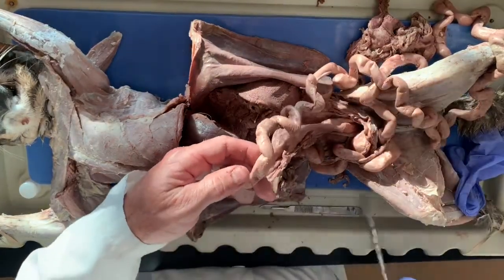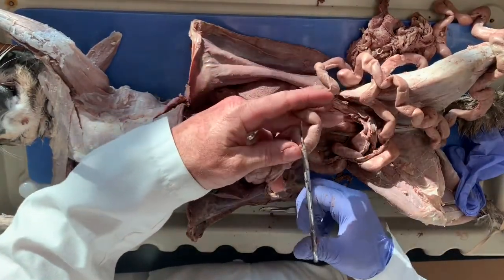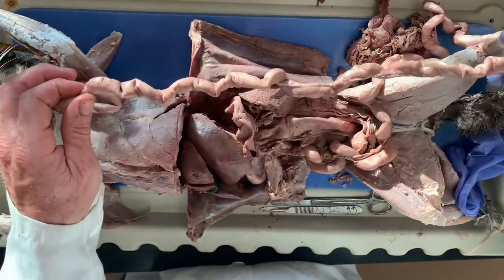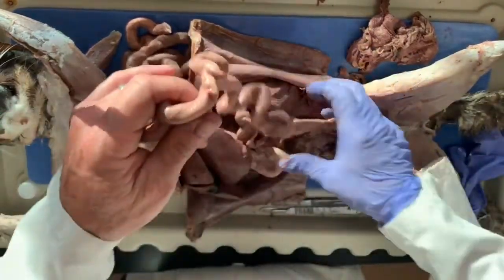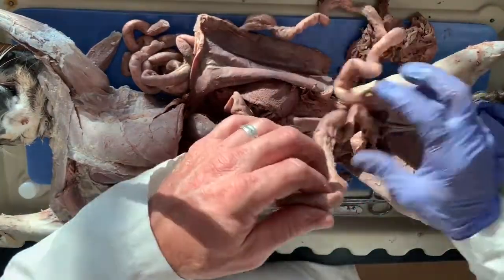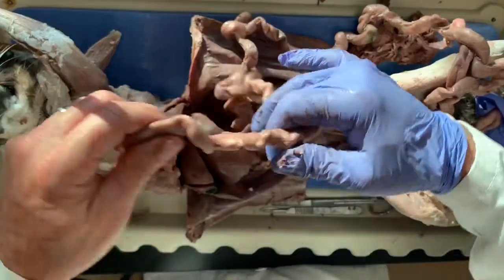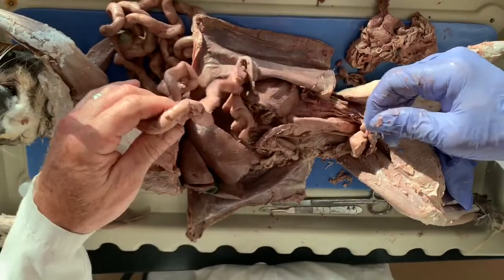Okay, so I'm going to make an incision right here. And I'm going to cut, this is the ileum. Okay, so the ileum is the last part. There's no clear demarcations. The jejunum is in the middle part, and actually most of it's jejunum. And then the upper part right here is the duodenum. So the duodenum is the smallest, the jejunum is probably the biggest, and then the ileum is at the end. Okay, so you can see how much intestine this cat has. I mean, it's pretty extensive, right?